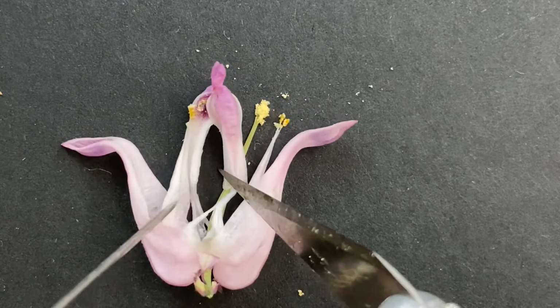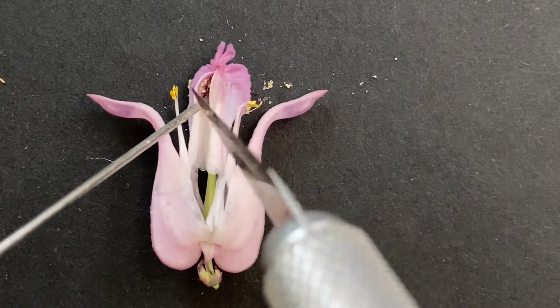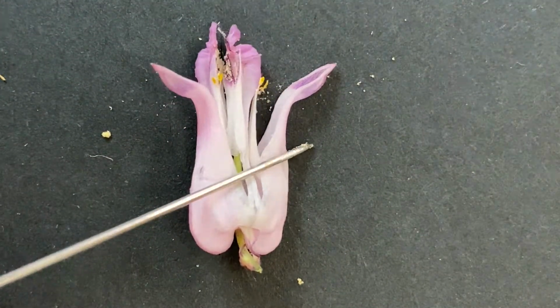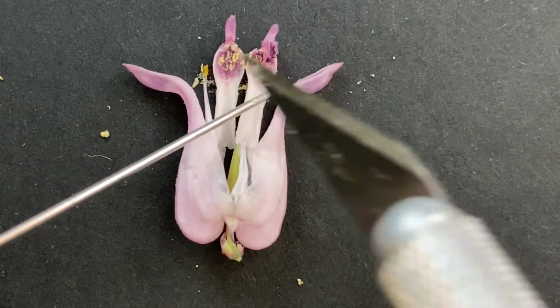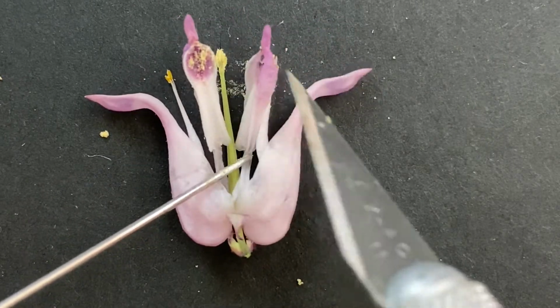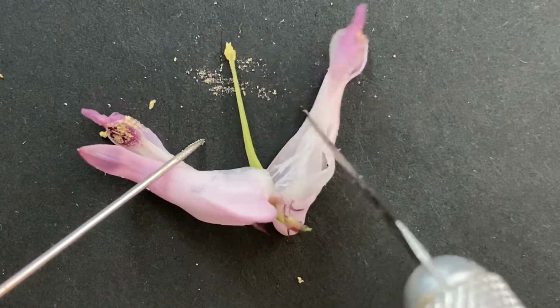So we're going to pull them out of the corolla. And then this up here is our corolla. And again, it has 2 sides. So we're going to split that. I want to do it without breaking anything. There we go. All right. So there we go, the 2 halves of the corolla. So really these are the petals, right? And so we can't have 2 petals, so it's fused. And you can kind of see on the back, see this nice wavy part, so that's where they're getting fused on the back. And then here in the middle, there's our pistil, right there.